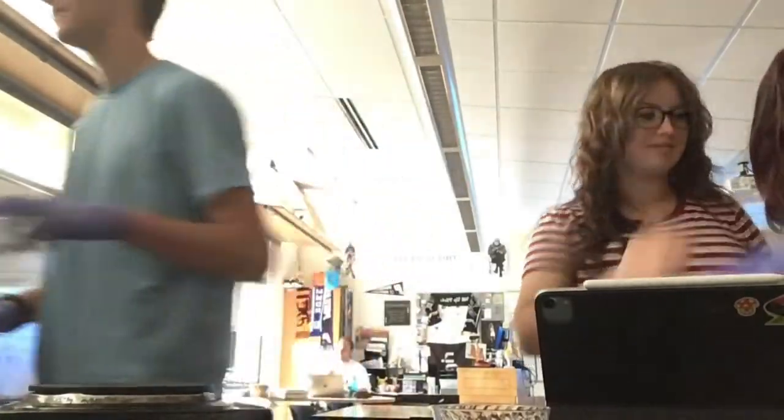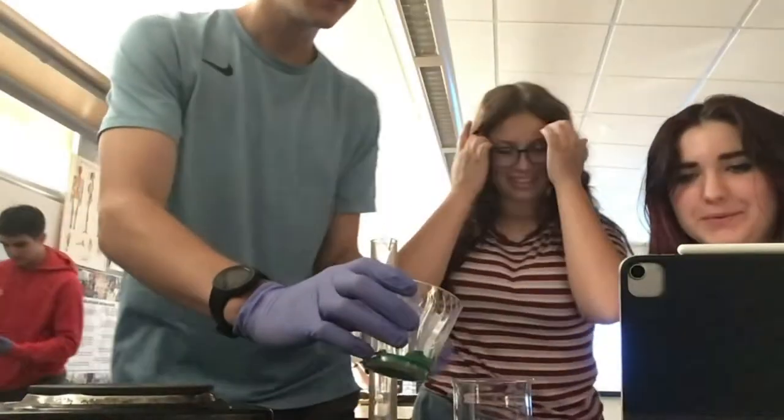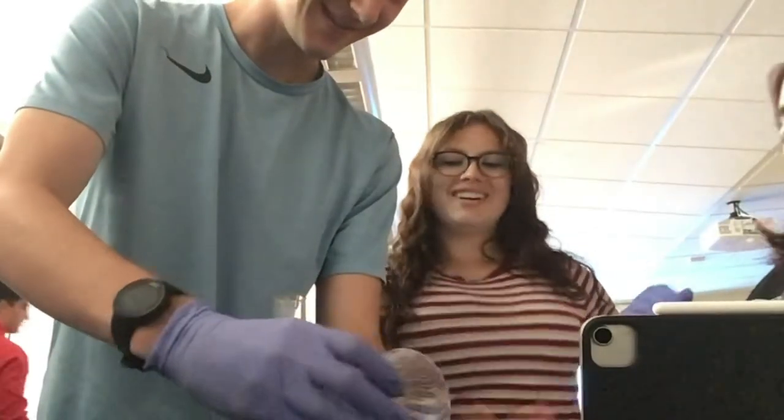Glove situation. Place this copper sulfate into a... get a beaker! Get a beaker! Do I just pour this in now? Wait. Is it even good at pouring? How could that be bad at pouring?